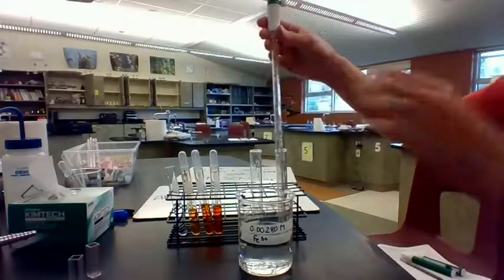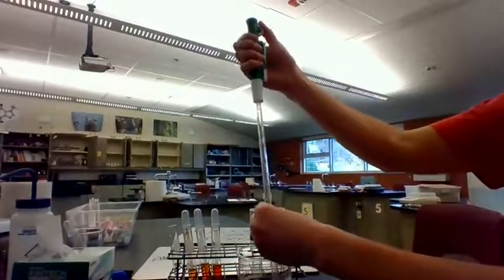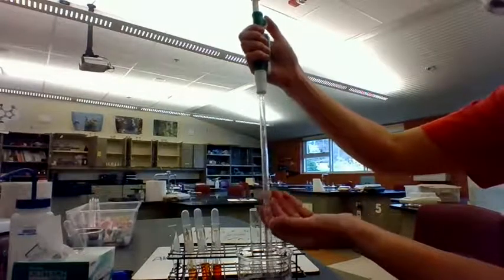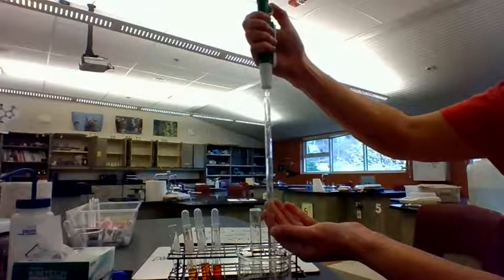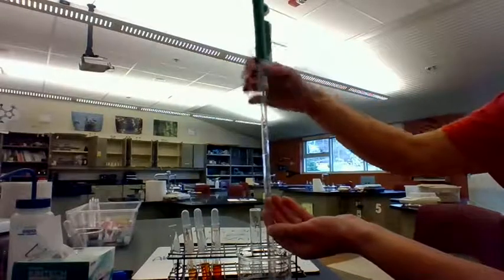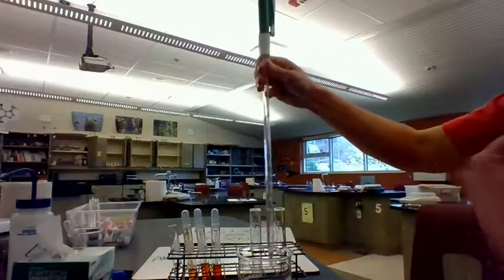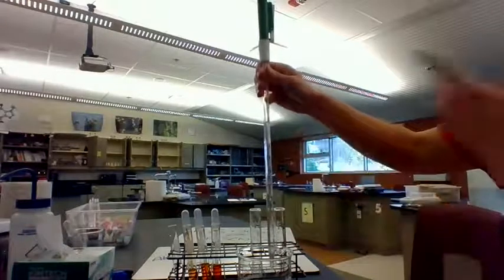And the way that the volumetric pipette works, you use this pipette filler up here, and we kind of dial it up like this, and you may not be able to see this very well, but the liquid is moving up the pipette, and what you want to do is fill this up to 0. Okay, so now it's at 0. And 0 does not mean that there's 0 milliliters of liquid in here. It just means that this is calibrated to deliver. So that means I have delivered 0 milliliters of volume. So right now I've just filled it up to its starting point.